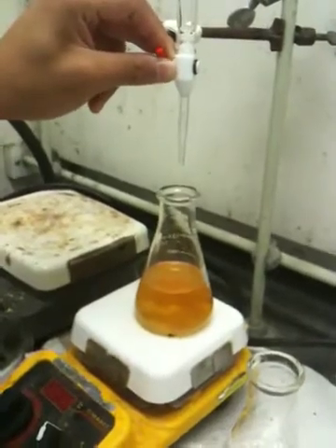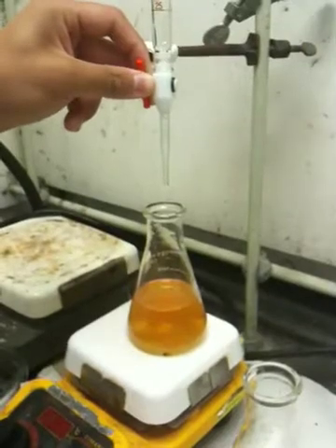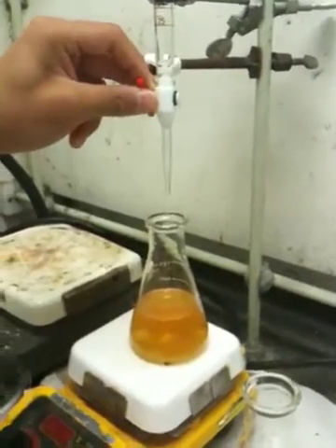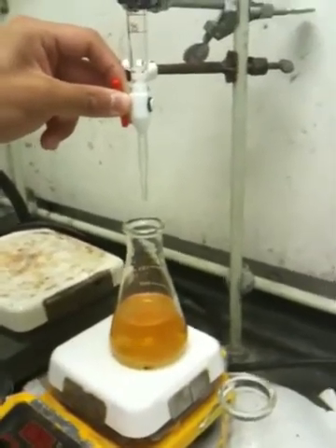And inside that — that thing swirling around is a magnetic stir bar. It's pretty cool. So he's being very cautious because he doesn't want it to go completely clear, or else he's something we call S-C-R-E-W-E-D. Screwed. Which happened last time.